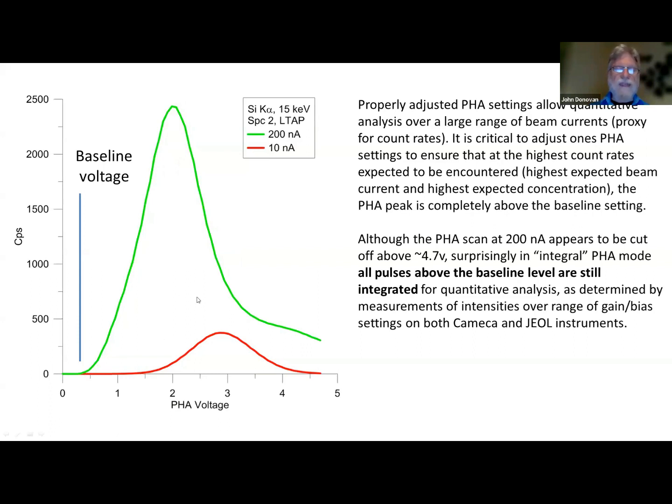So we want to make sure we have enough gain or bias that we push these curves above the baseline voltage. So no matter what beam current we're using, we're still going to get a linear response from our detector. And by the way, this doesn't matter because in integral mode, those counts, even above the plot here, you won't see them. The instrument does not plot these up, but you're still going to measure all those counts. That's why people thought they could filter higher order pulses. But if we run in integral mode, all those pulses get counted.